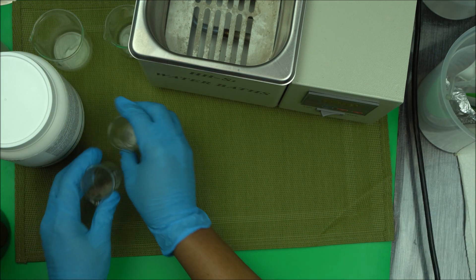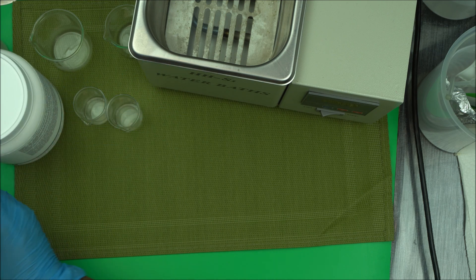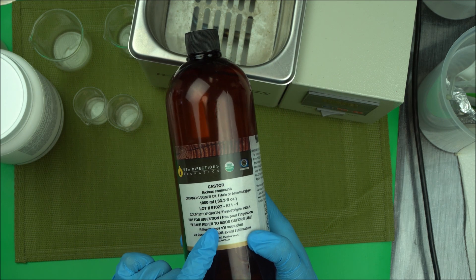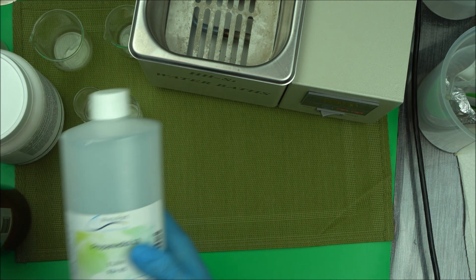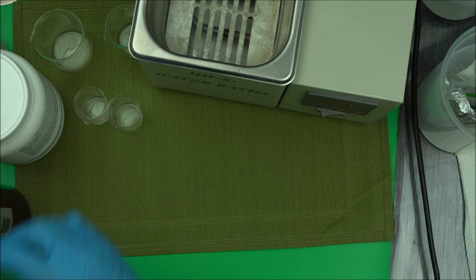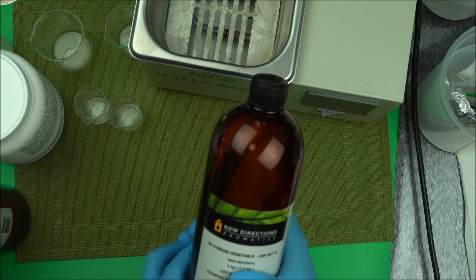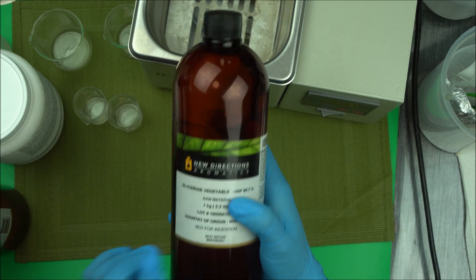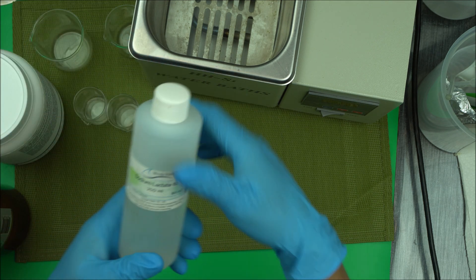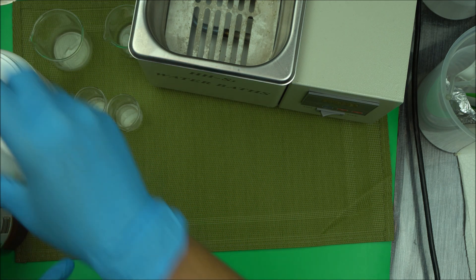Just bear with me here as I take different beakers. I'm going to show you how to use castor oil to dissolve your salicylic acid, how to use propanediol 1,3, and also glycerin to dissolve salicylic acid. Finally we're going to try sodium lactate to dissolve salicylic acid.